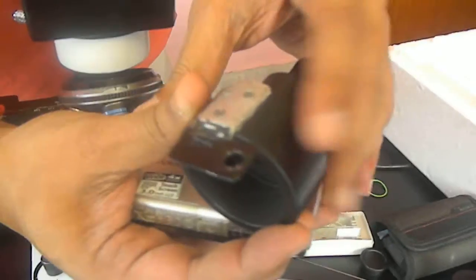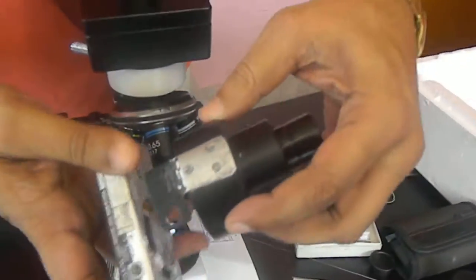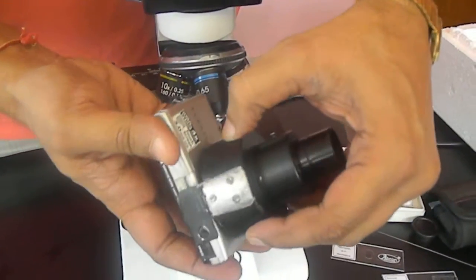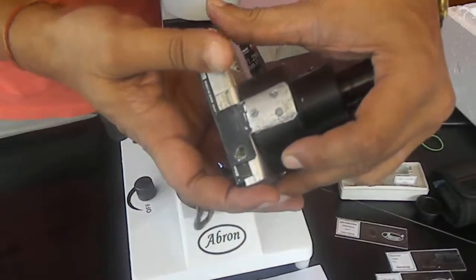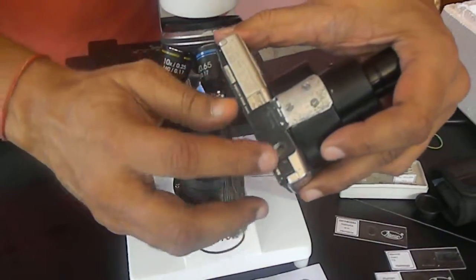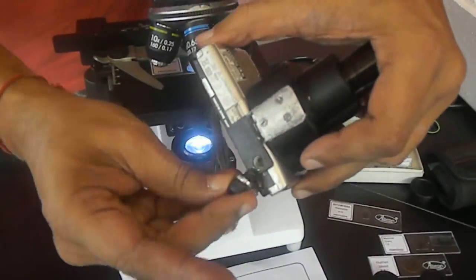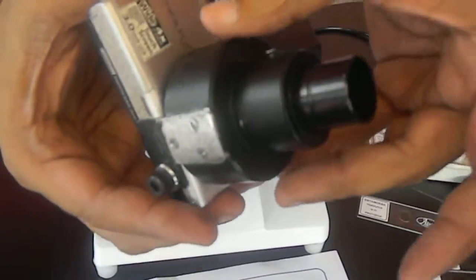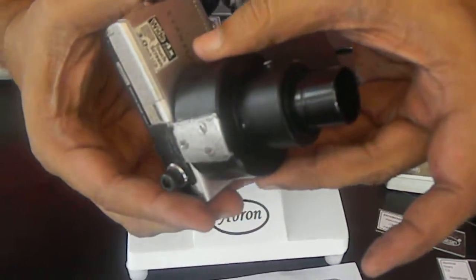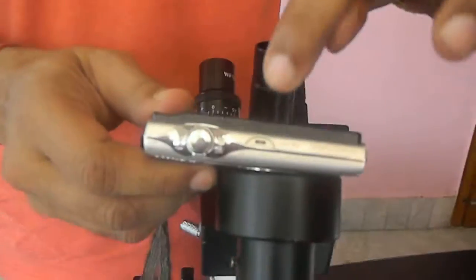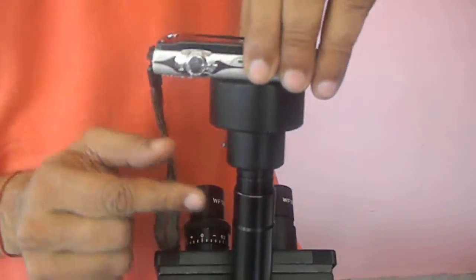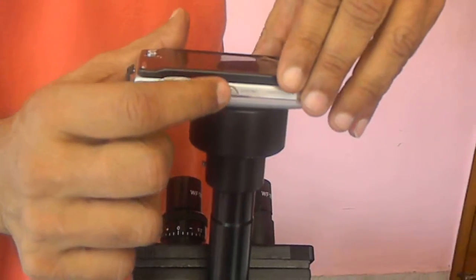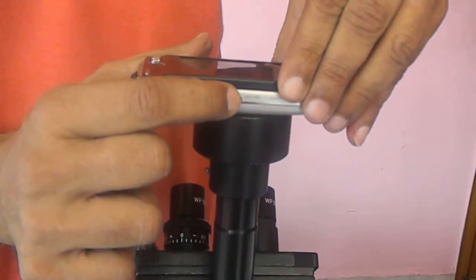We place both the things so that this camera tube is put here and this lens we fix with the screw on the camera. Now this tube camera is ready. We take it and see that this is on the front side. We place it in the tube and now this is ready. You can switch it on.